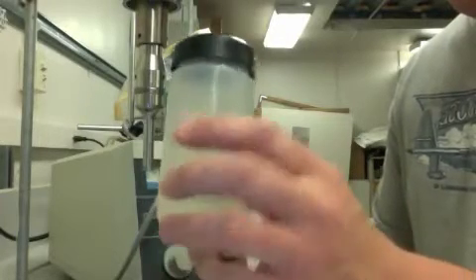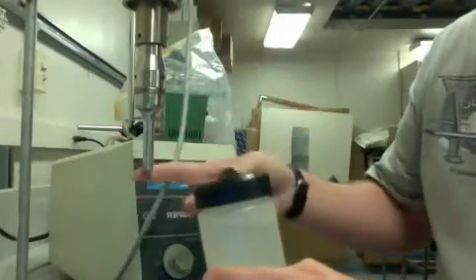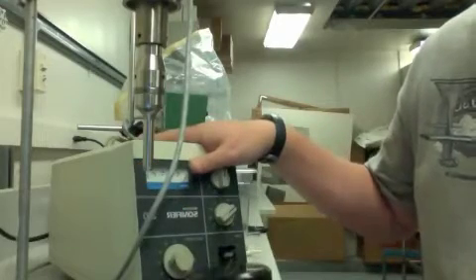One more thing you're going to do with your soil sample is sonicate it. That's what this bad boy is. This is the sonicator. It's the sonicator tip. Here's all the controls to get it started.